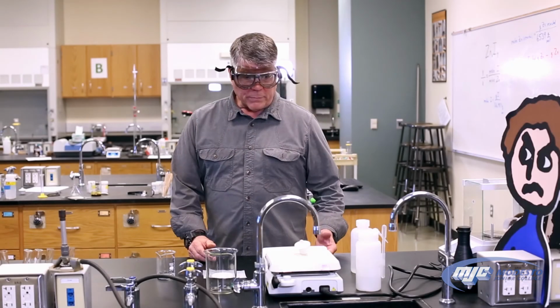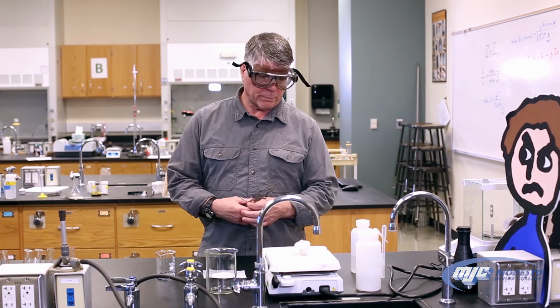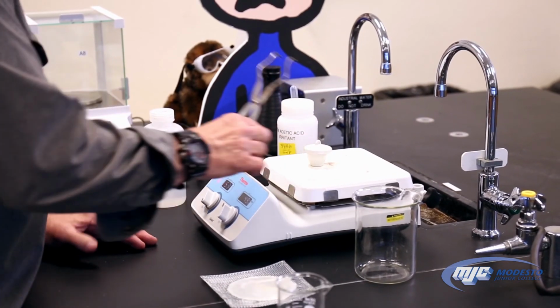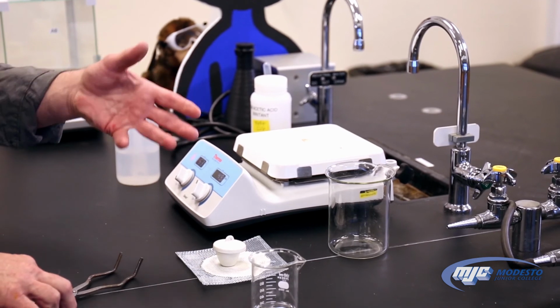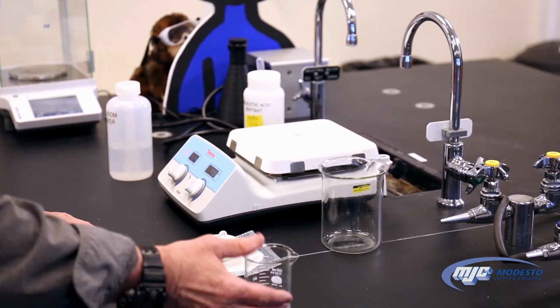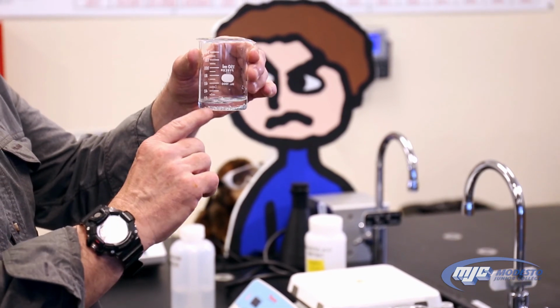All right, guys, now we've been heating this crucible up for a full 20 minutes, 5 minutes halfway, 15 minutes all the full way. Now we're ready to weigh it for the first time. Put the lid back on, take it off, set it on our wire gauze until it's cool enough just to pick up by hand, then we'll weigh it. While we're waiting for that to cool, come back, look at our zinc iodide, we can see that all the iodine has reacted because the solution is completely clear now.